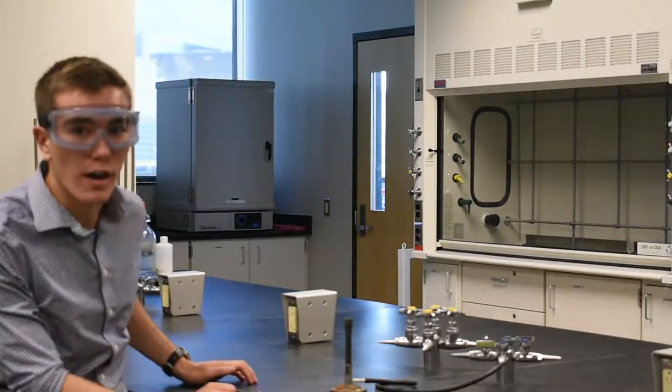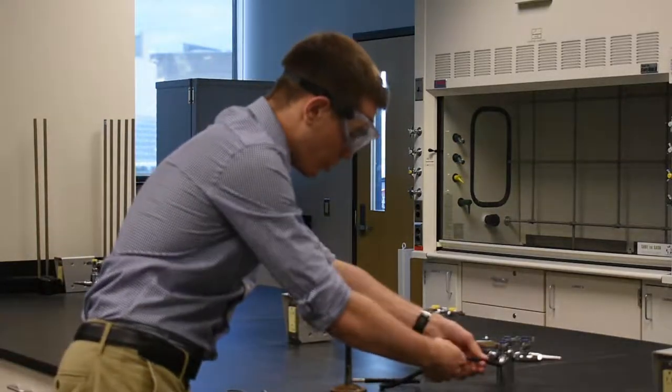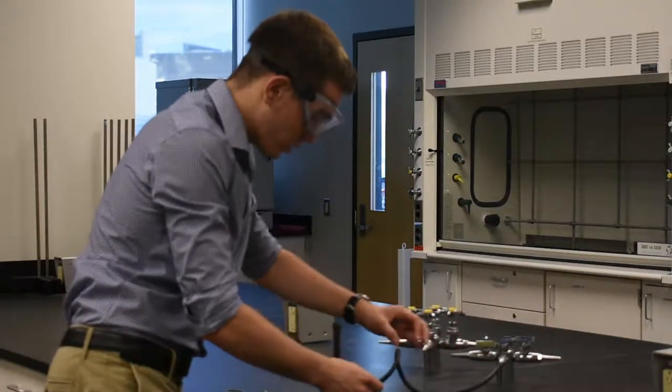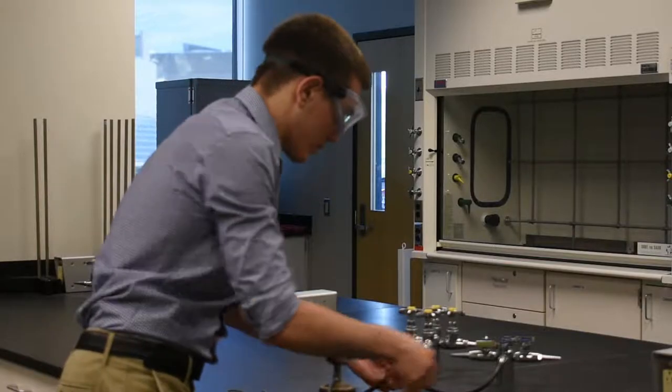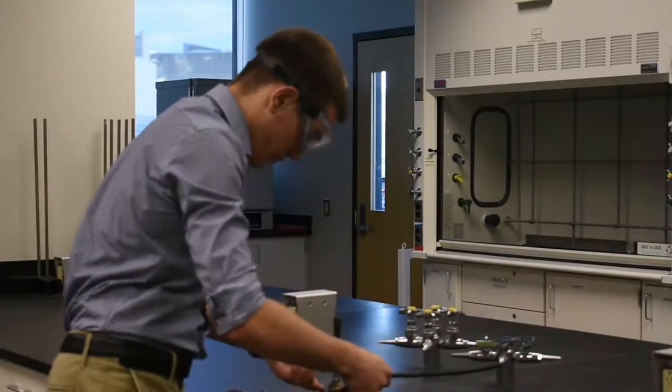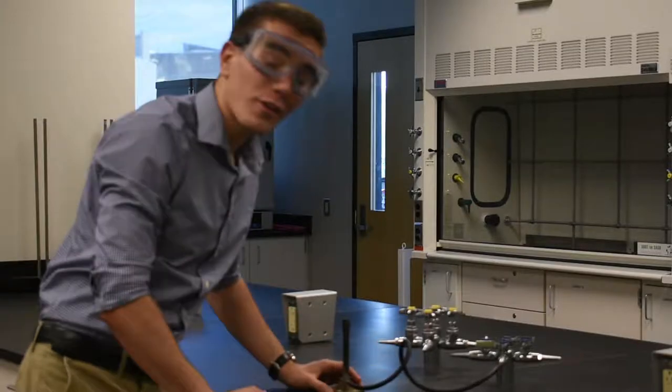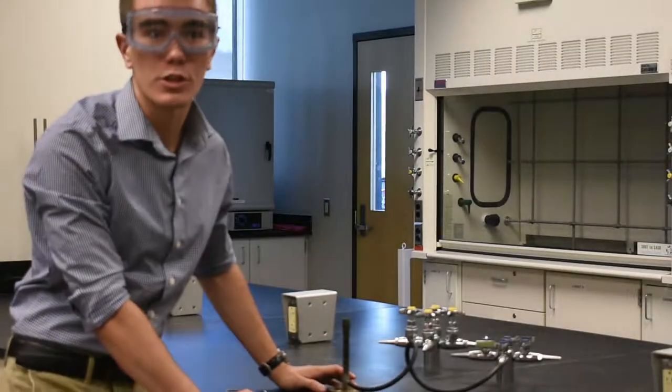So, to start off, we're going to check this tubing for any cracks so that the gas doesn't leak out. As you can see here, there's no cracks in the tubing, so it's safe to use.